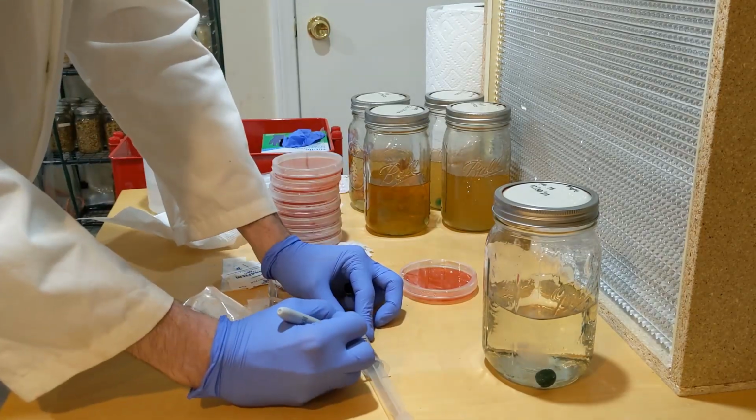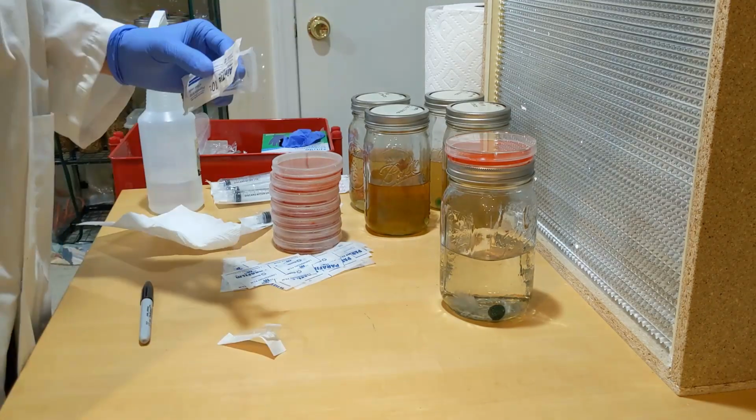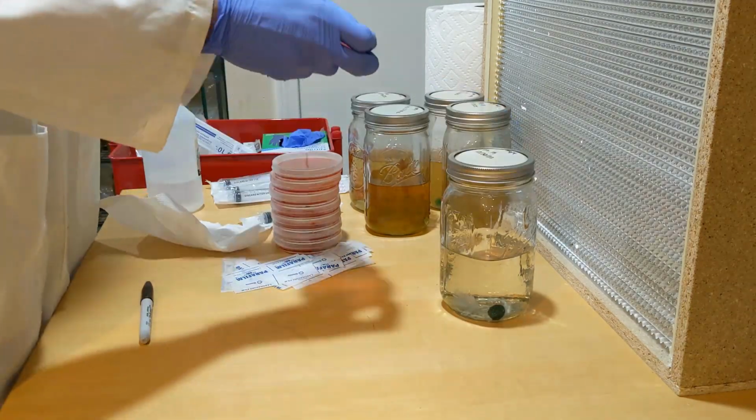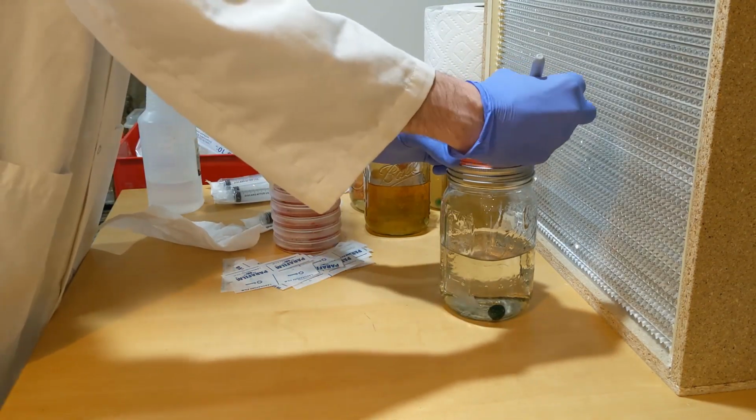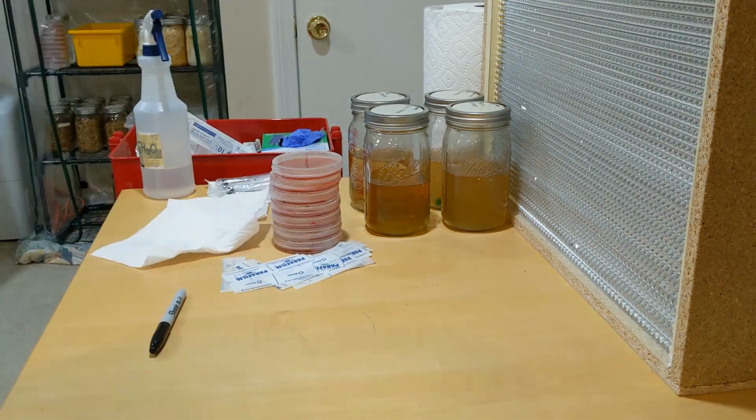I decided to also label my syringes after I used them in that specific liquid culture, because I had planned in mind that if those cultures are clean, I will reuse those syringes so I can save on cost a little bit.